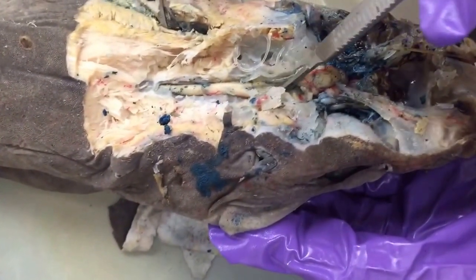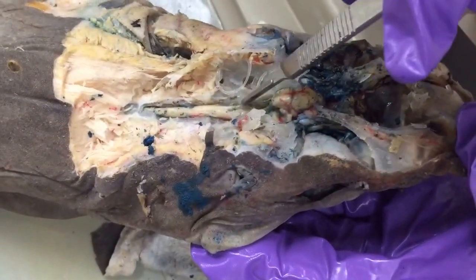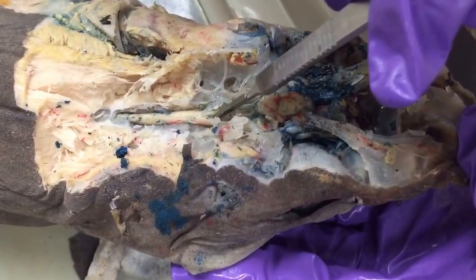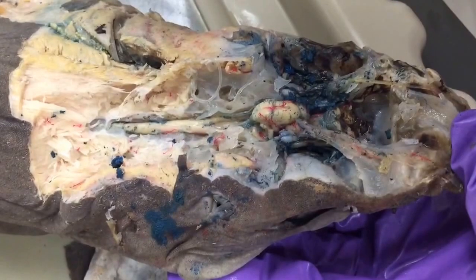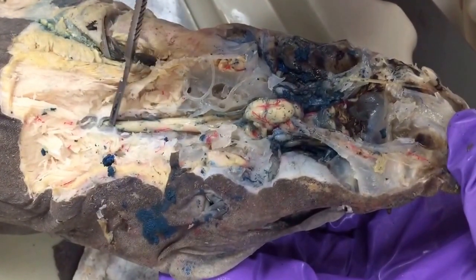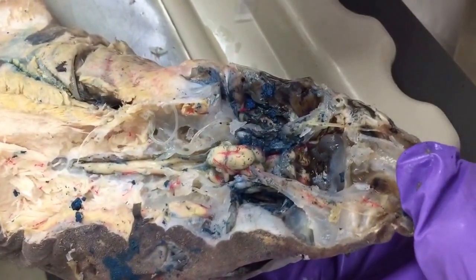You can see it's kind of Y-shaped here and more expanded than the spinal cord back here. So this is the medulla oblongata, and this kind of groove here between the two Y-type structures is called the fourth ventricle of the medulla oblongata, whereas this whole structure is the medulla oblongata. Okay, and then here, once it's no longer expanded and running down the spine, this is the spinal cord. Okay, so we're going to skip back up to here and go over some of the nerves.